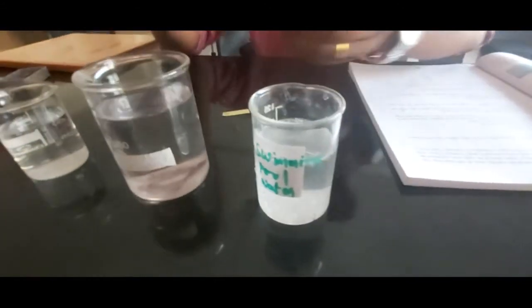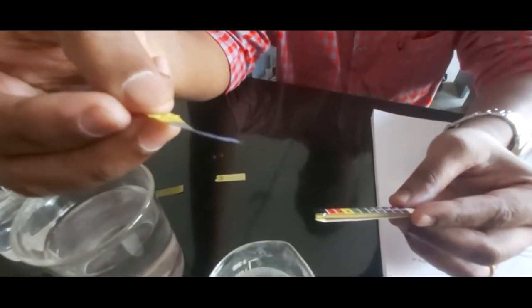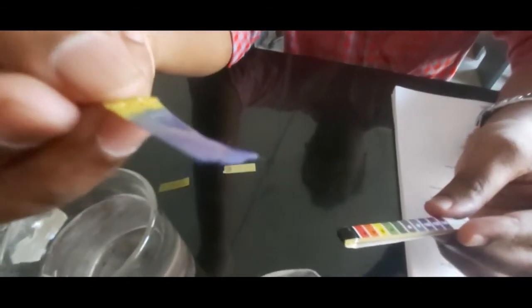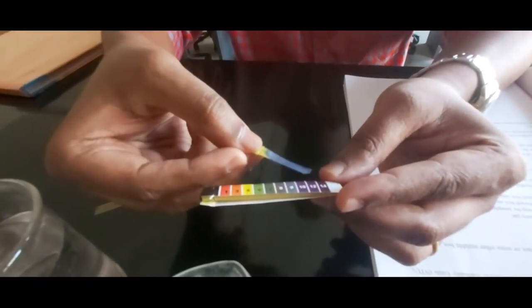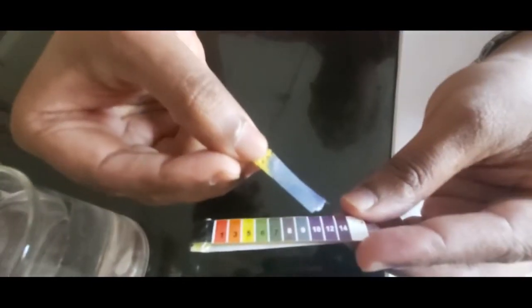The last one is the swimming pool water. When you dip the pH paper in the swimming pool water, you will see a sudden change in the color of the pH paper. The pH paper changes to blue, which indicates the alkalinity or basicity of the water. So approximately it is 12 on the pH readings, meaning the swimming pool water is highly basic in nature.